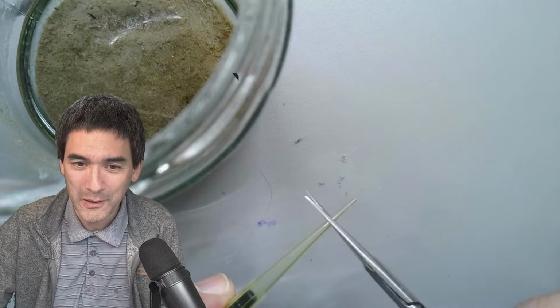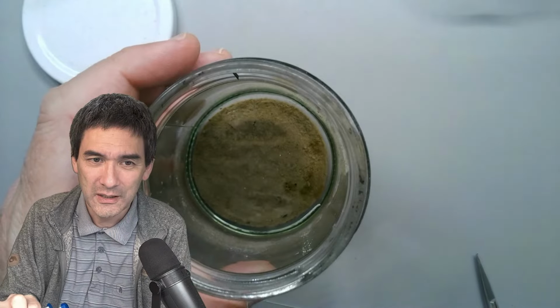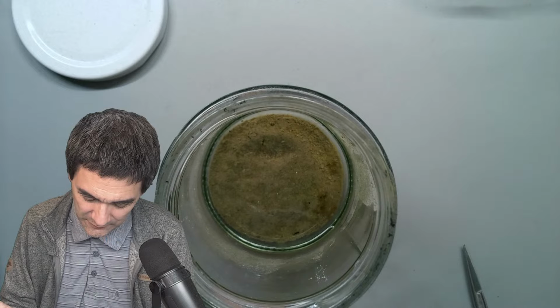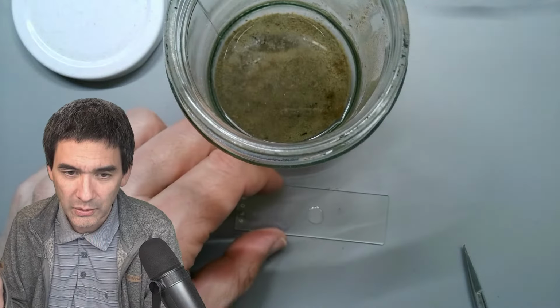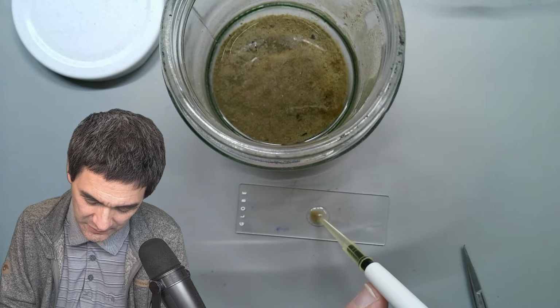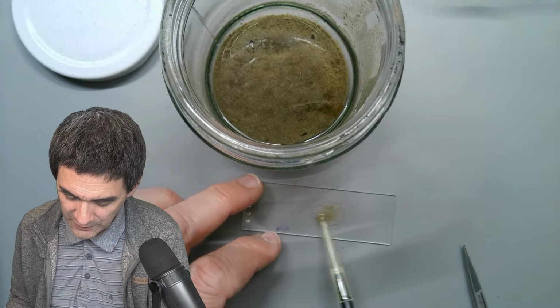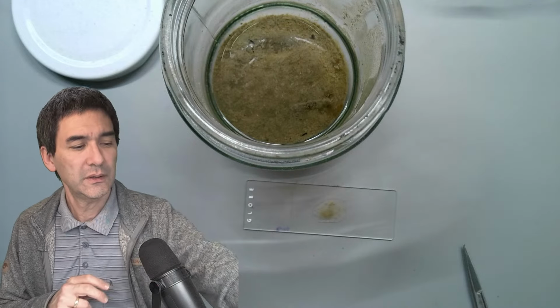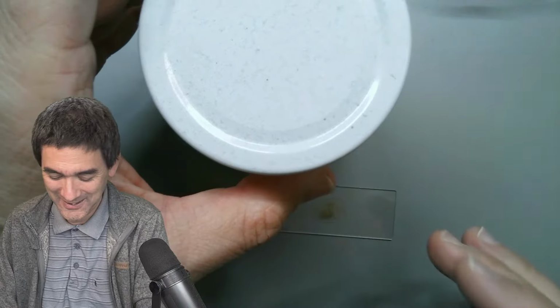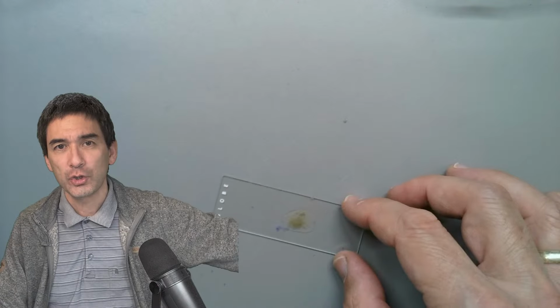So look what I'm doing. In order to pick up some sand grains, I have to make it a little bit larger here. Let's have a look if this still works. Not enough sand. You cannot see it because I was too low here. At least a couple of months ago, I was still able to find a couple of moving diatoms in here, but I have not very high expectations. But you never know. In microbiology, you call this a stationary culture. Very stationary. Stationary means when there is no more growth of microorganisms, usually bacteria, then you call it stationary.